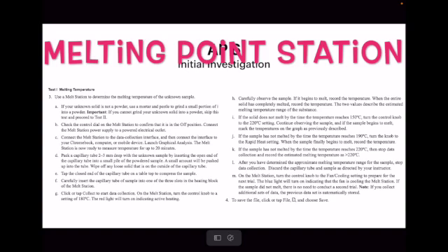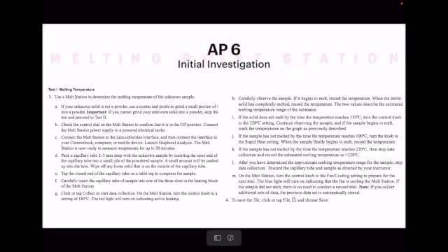If it does not melt within a certain parameter, it means that the temperature is higher than that which the melt station can produce, and that helps you identify which your substance is. If your substance starts melting, start noticing the point at which it starts melting, and then notice when it gets done melting. You're interested in that range, and that range helps you identify what you're looking for.